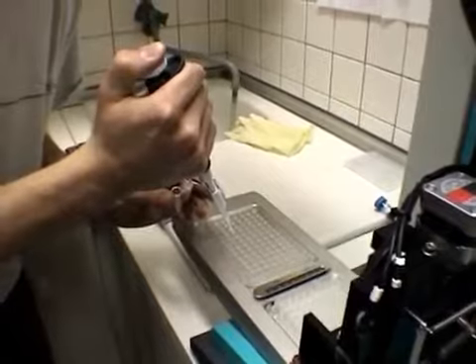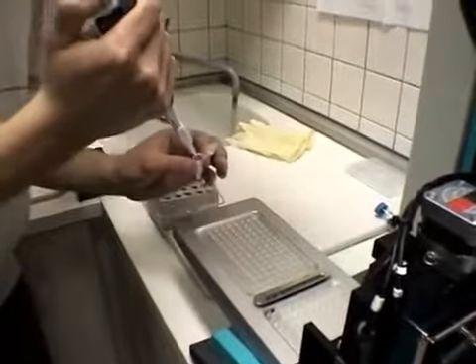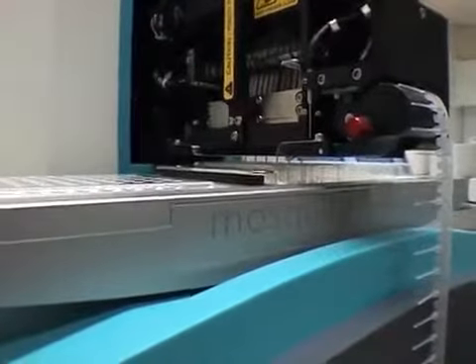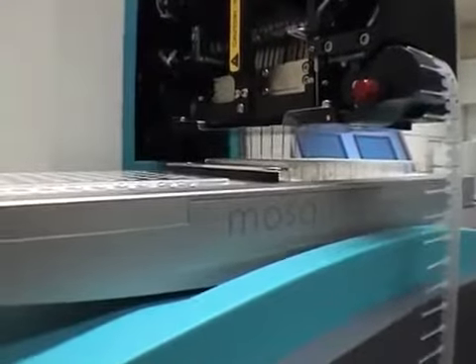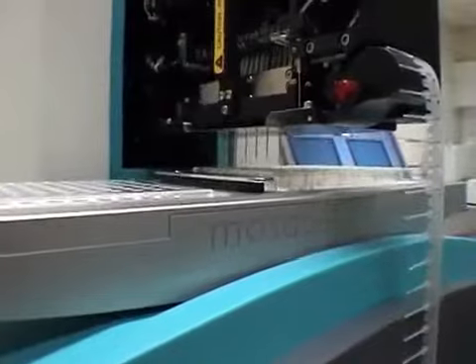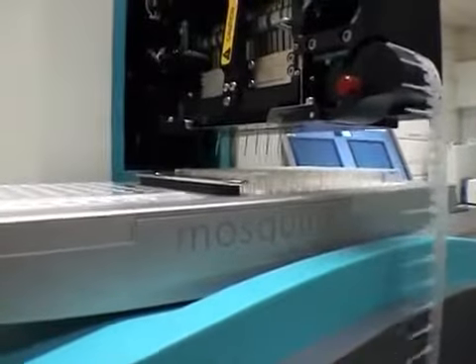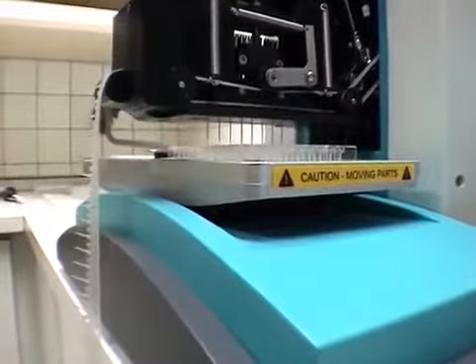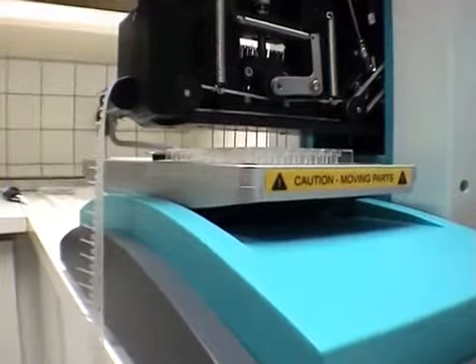to be crystallized. A computer controls the mixtures produced by the robot during the preparation of the drops for crystallization. As well as allowing very small volumes to be manipulated, the robot also accelerates the preparation of drops, thus permitting the number reached to be several hundred, if not thousands more during the initial screen.